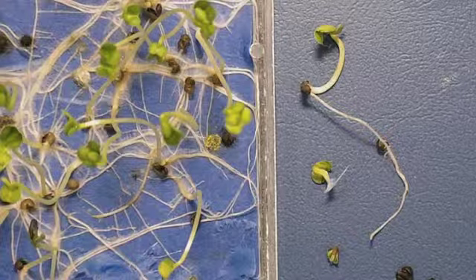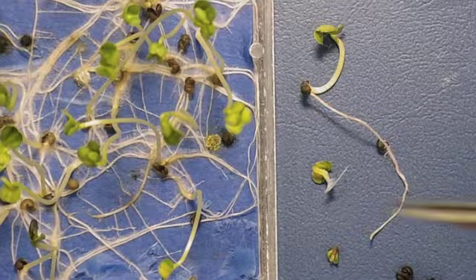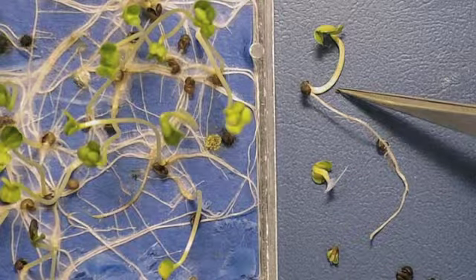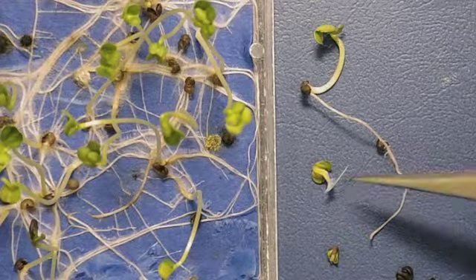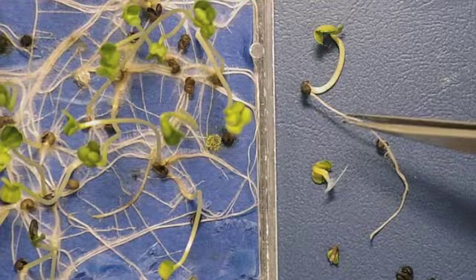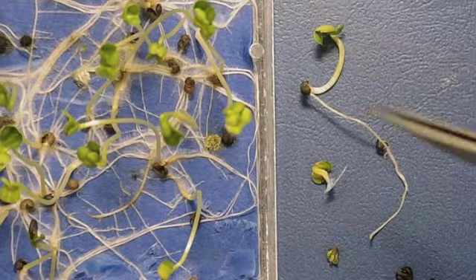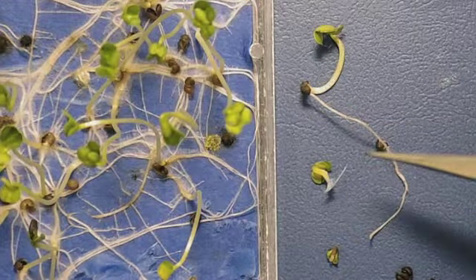Now it would have to be over 9% of moisture for this particular problem to start occurring, and it shows you with the different stages that it's starting to decay rapidly, and probably within the next couple of months the germination will be a lot worse, and we could be looking at what we have currently at 65 dropping down to about 40%.